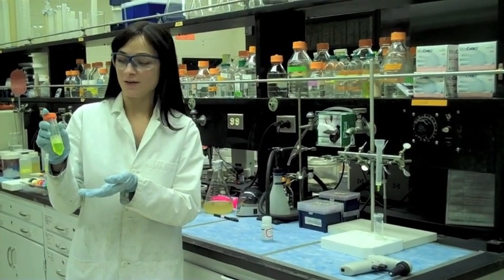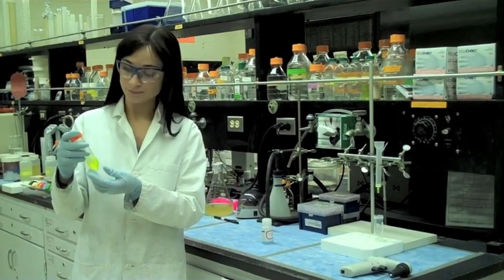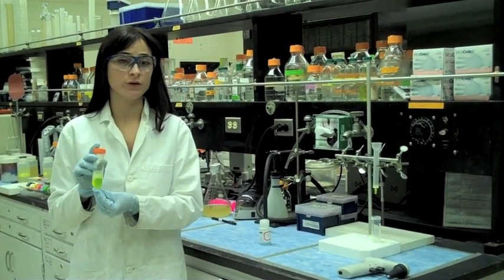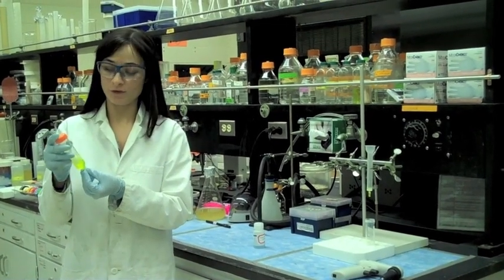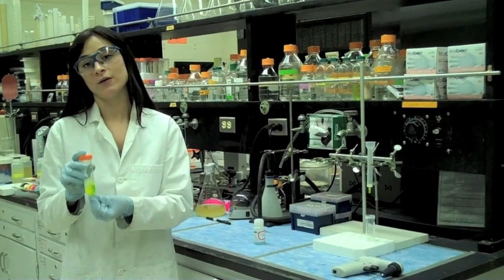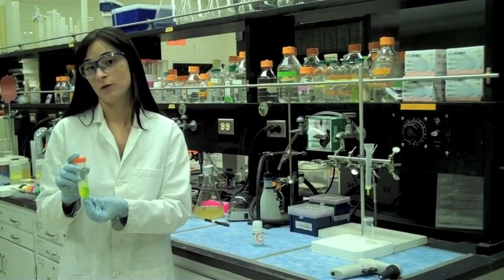This solution is our lysed bacterial pellet. Although we caused the bacteria to specifically produce the green fluorescent protein, we will still need to remove the protein specifically from the other thousands of proteins that the E. coli cell produces.